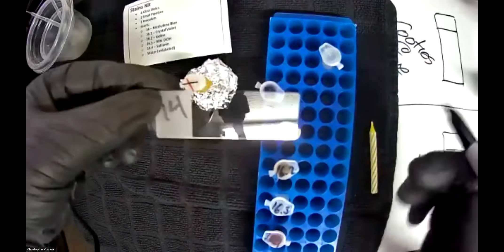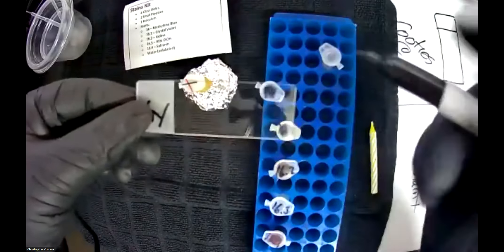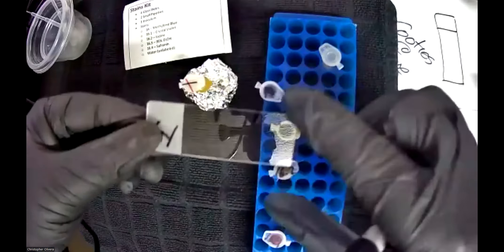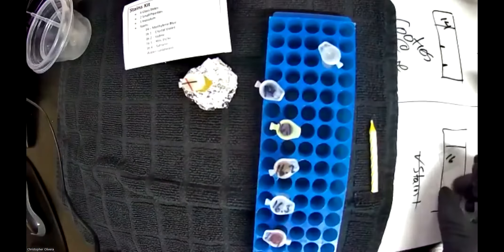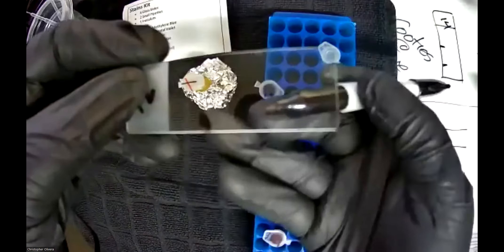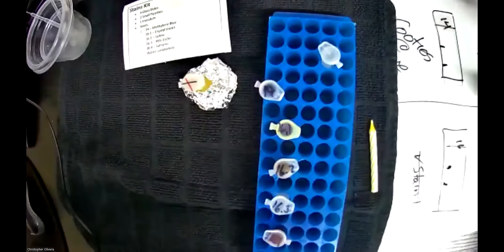I've written '14' on the top — I'm actually going to flip this and mark where my smears are going to go: one over here and one over here, on the underside so when I flip it they're below the slide. I'll do the same for the other slide — mark it from under, one over here, one over there — roughly speaking. So there are the two slides set up.